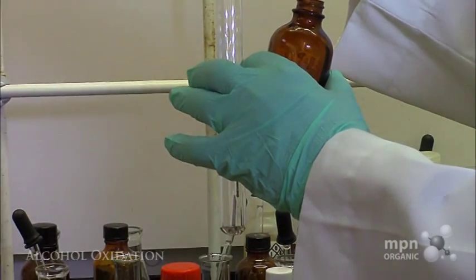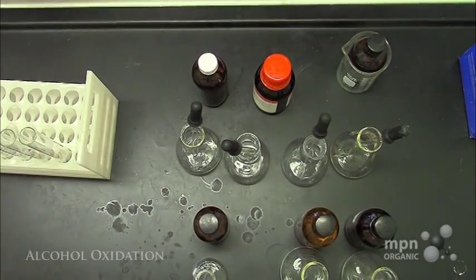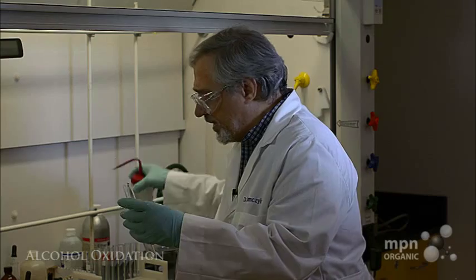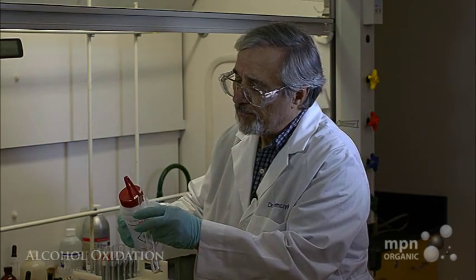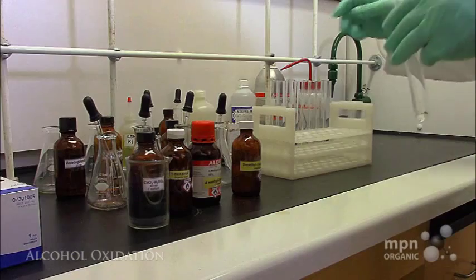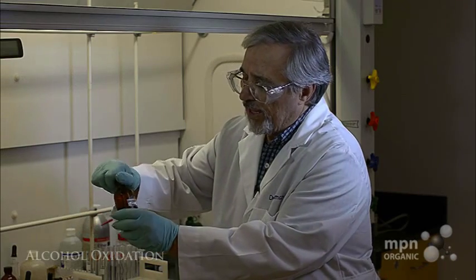Just put it in there, a few drops. And the solvent that we're going to use is acetone. Okay, so let's put some acetone in there. Don't need too much.